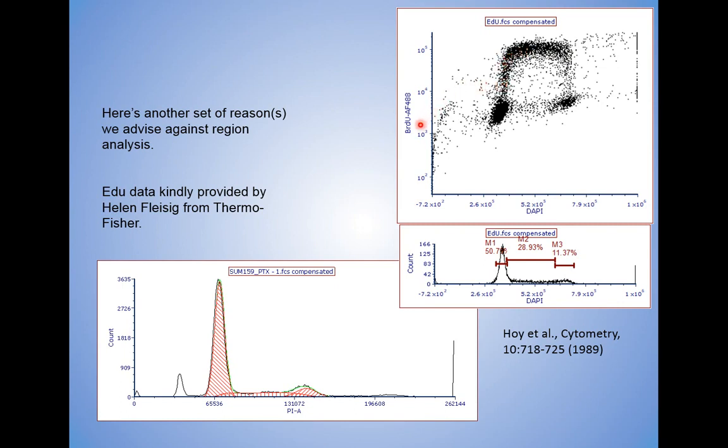They're incorporating the EDU or the BRDU Alexa 488. They're actually in S phase, where the red dot is all the way up here and all the way down here before they finally come into the G2M. What is this doing? This is taking the entire swath of events from here all the way up here and assigning them statistically to this M1 or G1, G0 in region analysis. That's the error. It's including cells that should not be included.